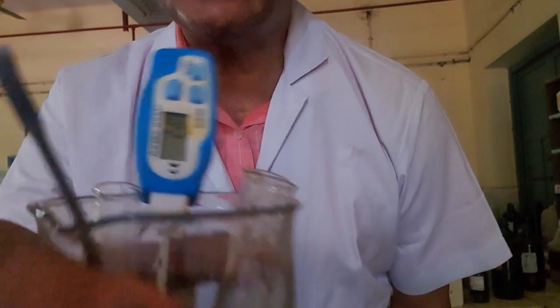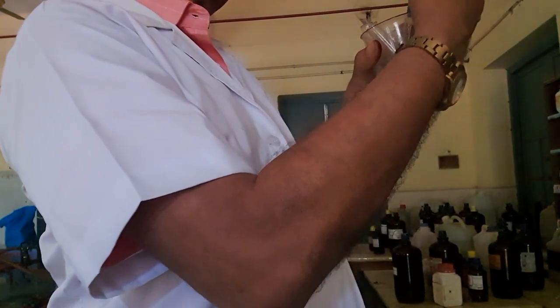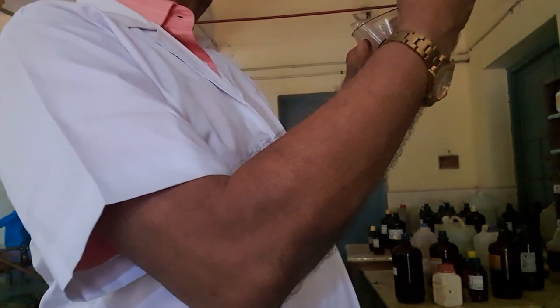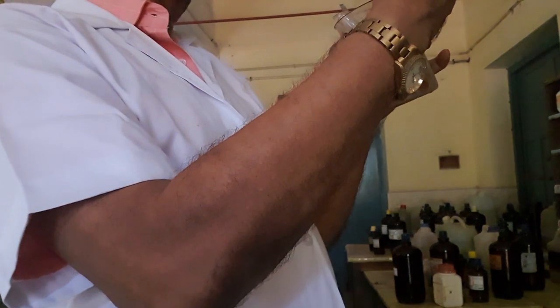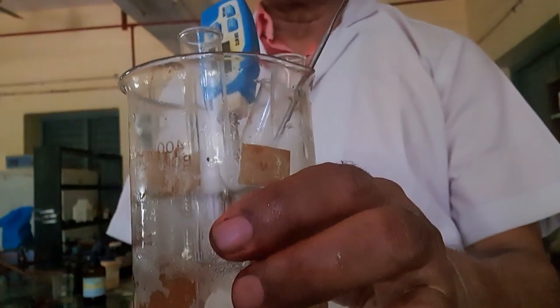Now, the room temperature is 36. It is now coming to 9.5. Kindly follow. It is now coming to 9.5. So I am still waiting to attain 0 degrees centigrade.